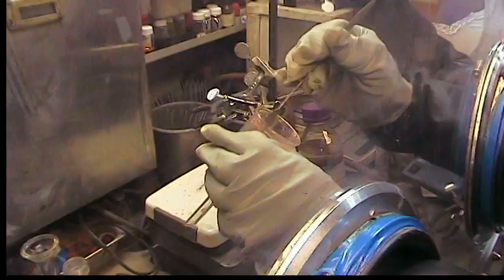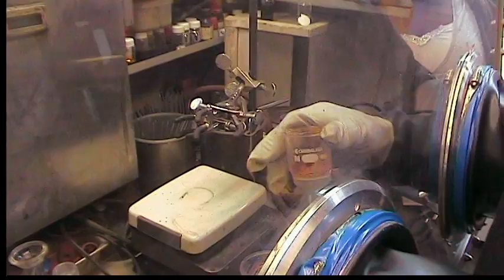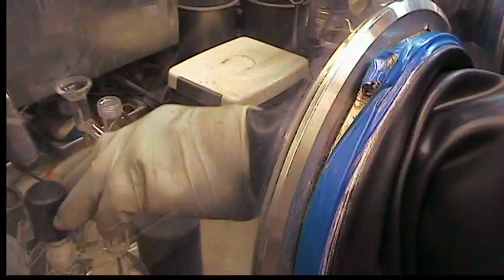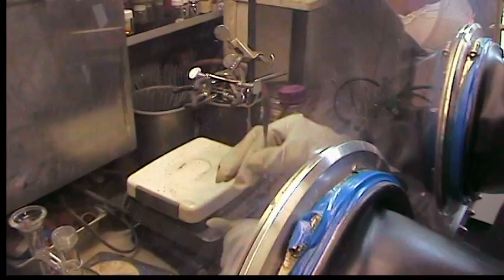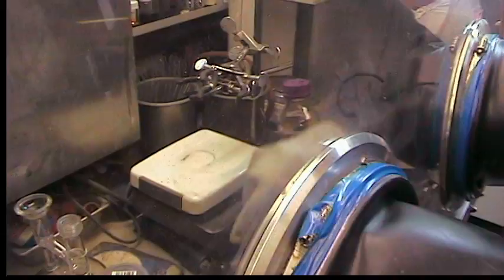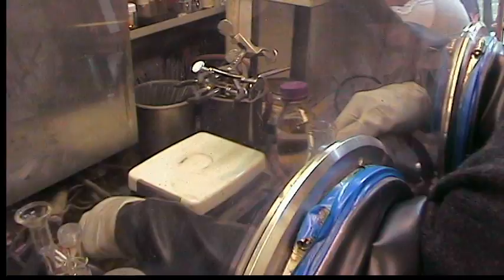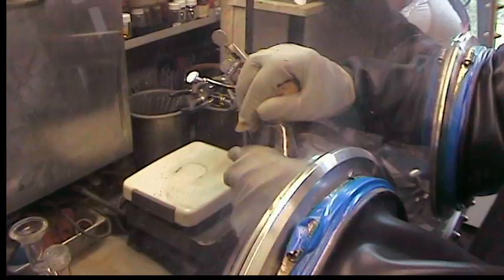While you're doing that, John, maybe you can say a few words about how our solvents are purified. So the solvents — we collect them in these specialized custom-made containers that we've designed for an SPS system manufactured by Contour Glass Company. The method is sometimes referred to as the Grubbs method for solvent purification. An interested viewer can read about it in an organometallics article co-authored by Robert Grubbs. It describes the use of alumina and copper mounted upon alumina to remove water and trace oxygen from solvents, rendering them both water-free and oxygen-free.